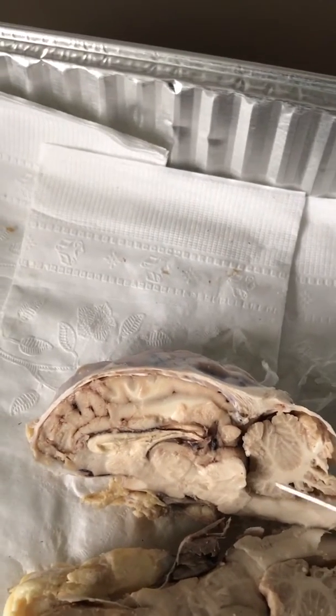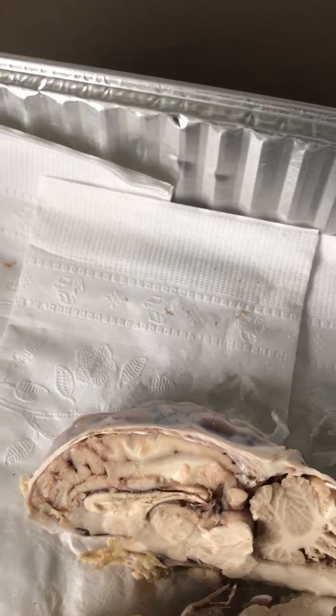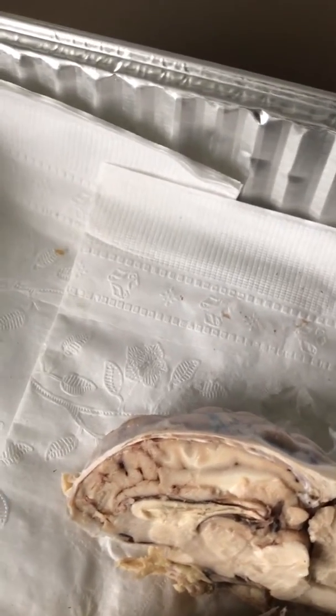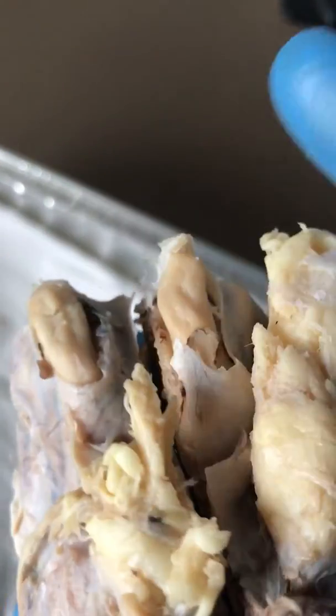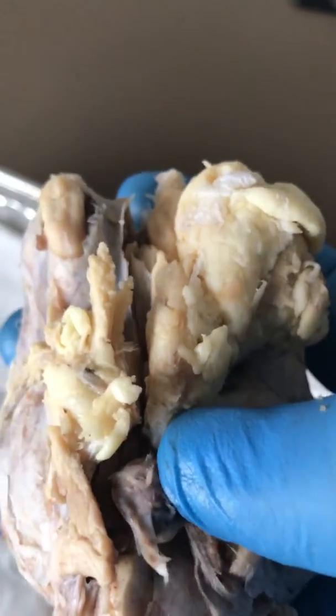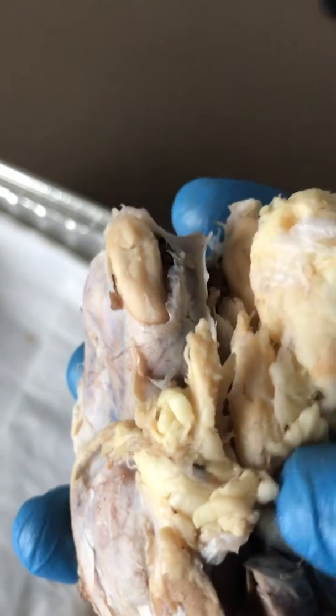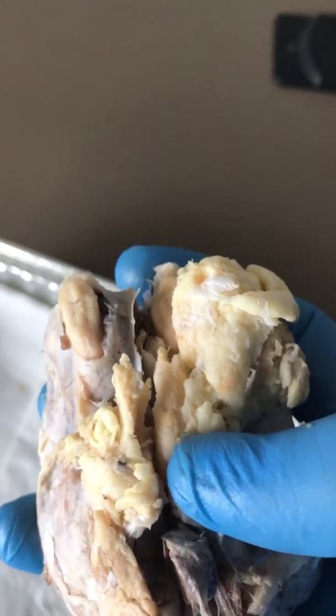So, going back to the midbrain, I'm looking for the cerebral peduncle. I believe that is down in here with some of these things that come up, maybe just these guys right here that come up into this, and then there should be two sets of bulbs, which would be the superior colliculus and the inferior colliculus.